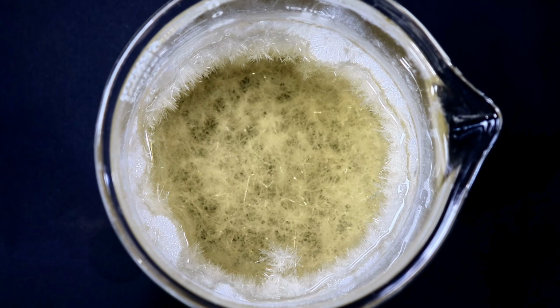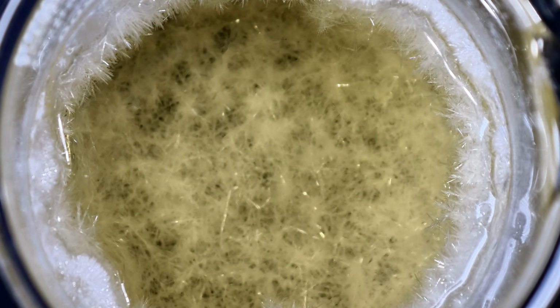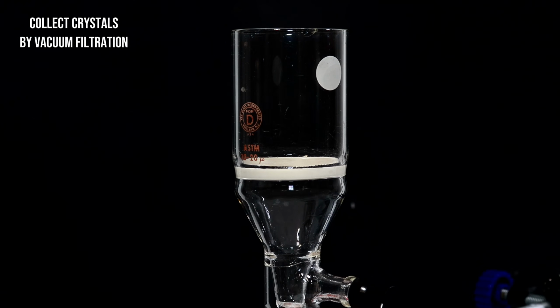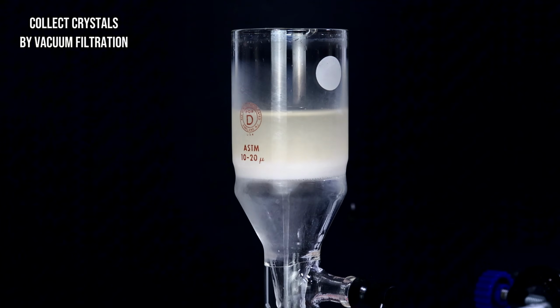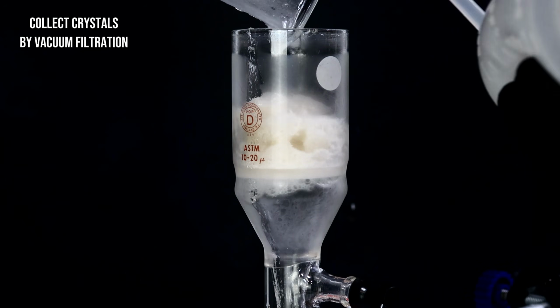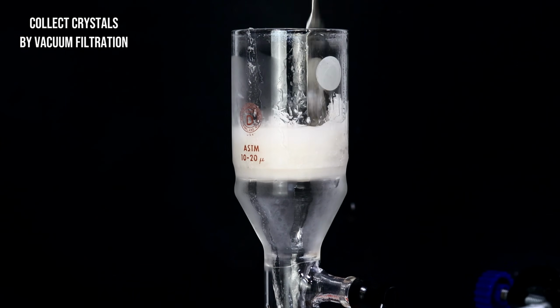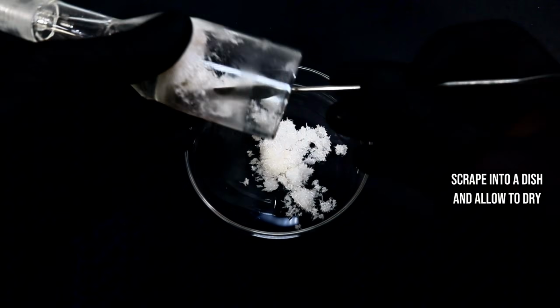In any case, I eventually put the beaker on ice to fully crystallize all my phenytoin and then collected the pure product in my Buchner funnel. This was once again transferred to a dish to dry, and once it had dried completely, I weighed my final product for a mass of 7.53 grams, representing a 62.8% yield from Benzil and a 40.6% yield from benzaldehyde.